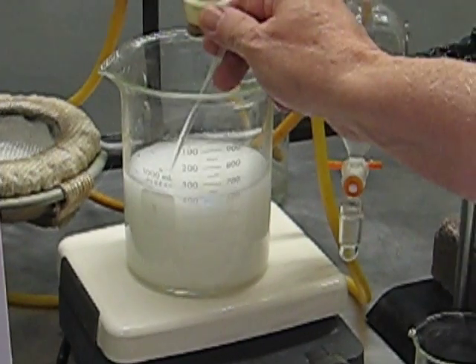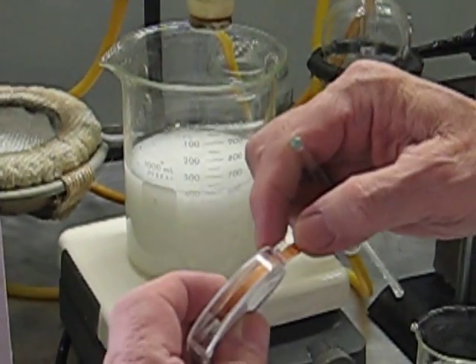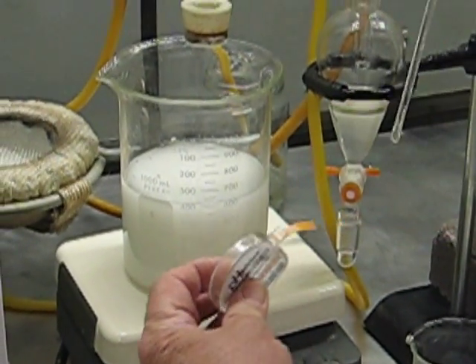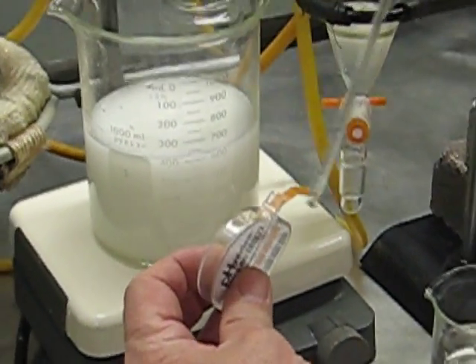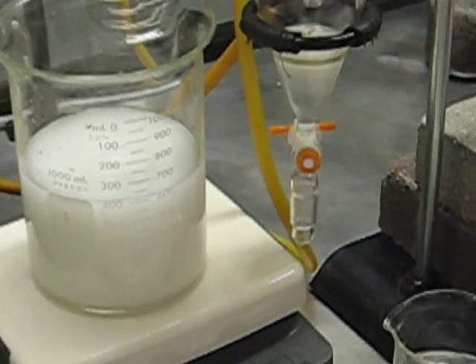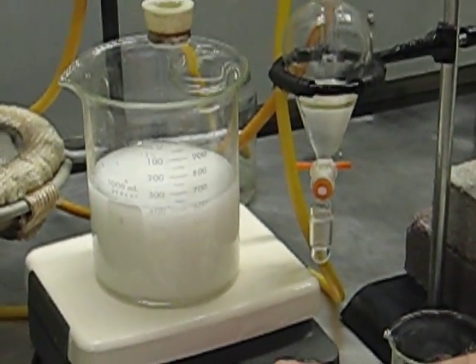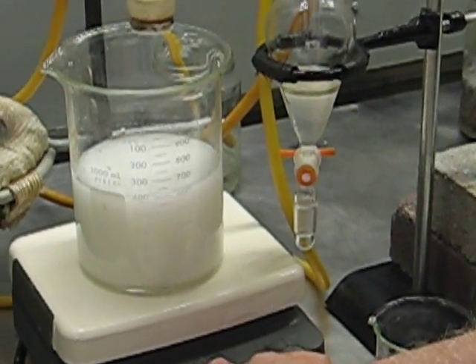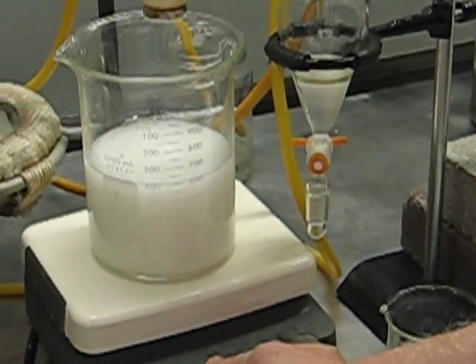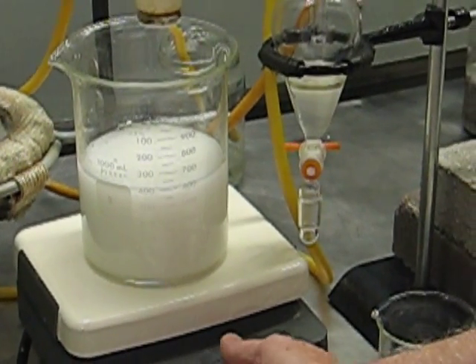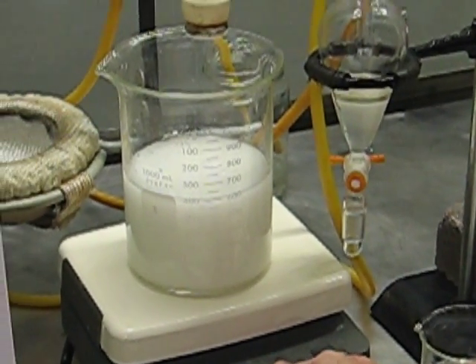Let's see what we've got now for pH. Let me get this down here. Okay. That's still pretty much neutral, so we're going to turn up the agitator a bit, hopefully.